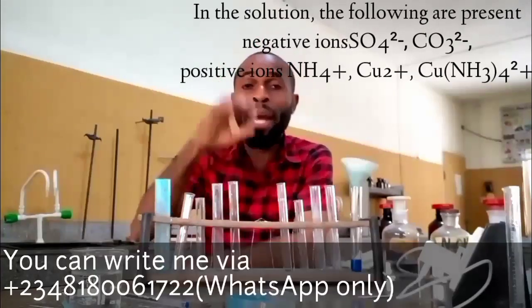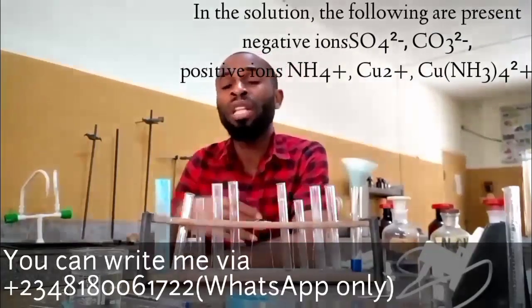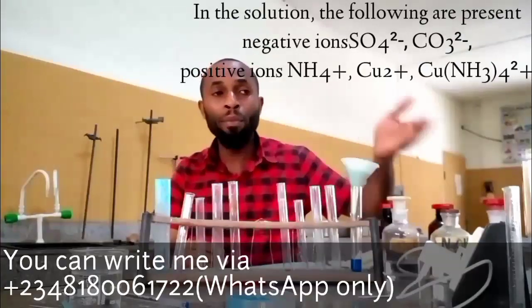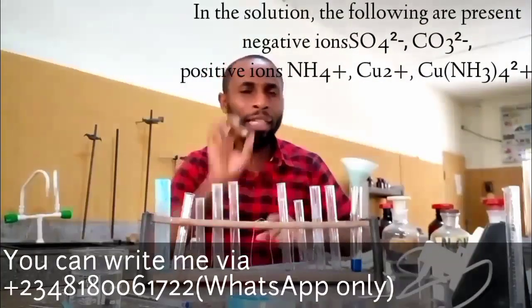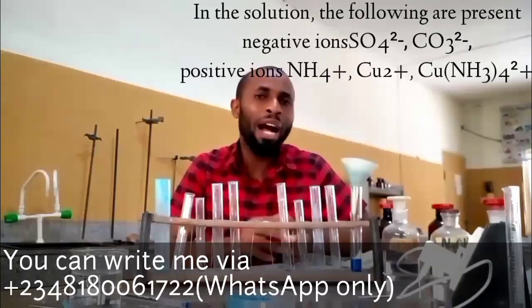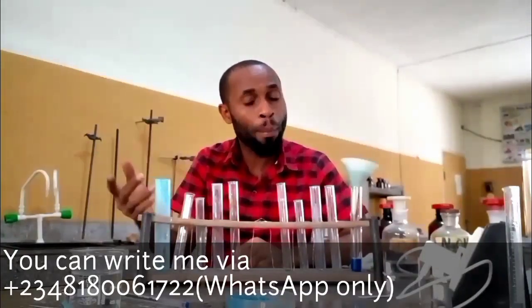And I'm going to tell you the one I believe WAEC will focus on. I believe WAEC will focus on the residue rather than the solution, because the solution is going to give us many ions, not just the negative radicals, but also ammonium ions and copper ions. And if you are a teacher, or a good chemistry student that has been following your teacher all this while, you normally understand that when you add ammonia to a salt and you have a pale blue, and when you add excess of that ammonia and you have a deep blue solution, it means that the salt contains copper, and that's the confirmation for copper.